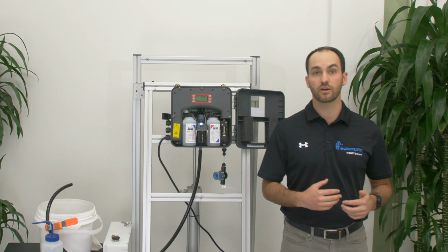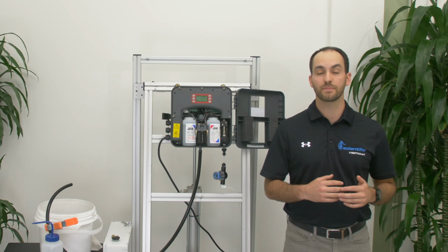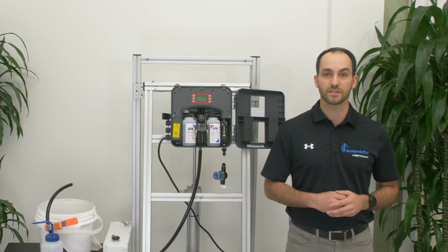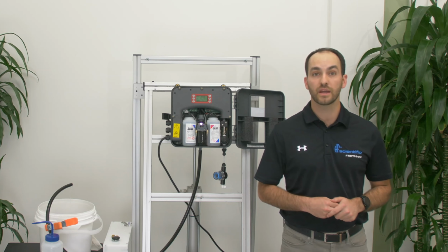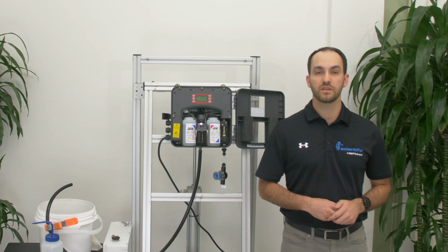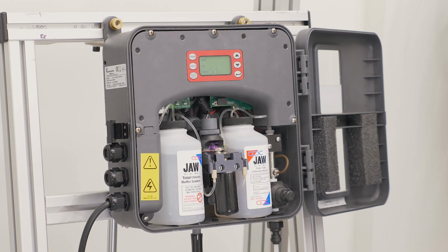The NPRG error can also be caused by issues on the front end with the intake solenoid. If you have the drain air gapped and the intake solenoid is not firing, there should not be water inside the cuvette. To test this, put the analyzer into a hold mode and verify there is no water coming into the analyzer. If you see water flowing in, you may have an issue with the intake solenoid. We'll press Service until the analyzer says hold.